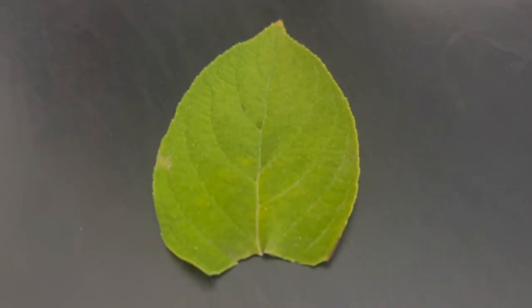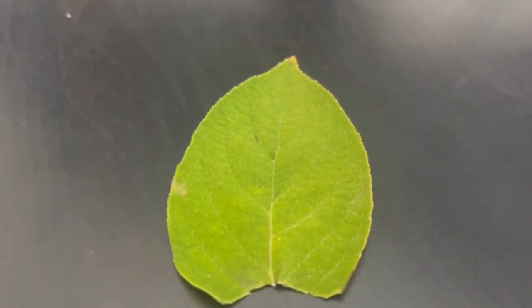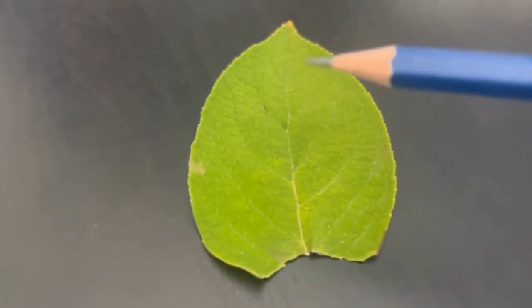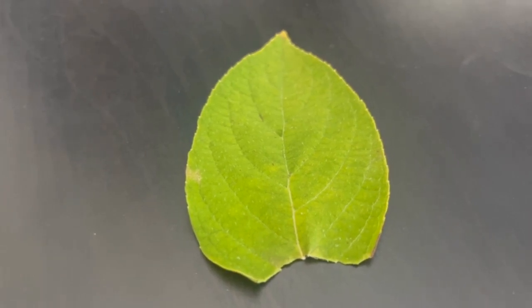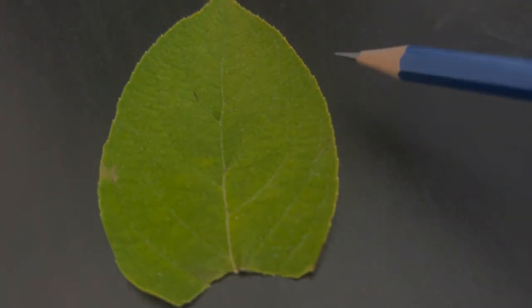While I don't think the type of leaf matters, the one I'm using has an obtuse shape which can be determined by the blunt tip. For the venation, I would say it's pinnate because it seems sort of spiral from the main vein in the middle. And as for the actual edges, I would say it's either denticulate or serrulate, which can be determined by these little jagged edges on the tip if you look really closely.